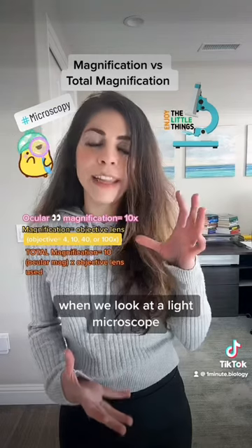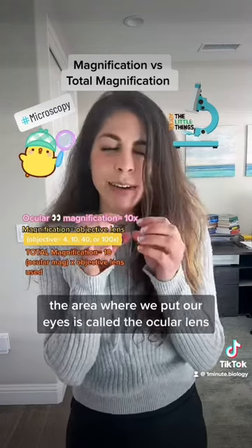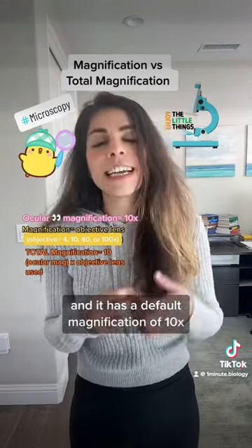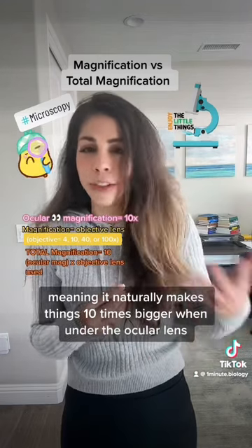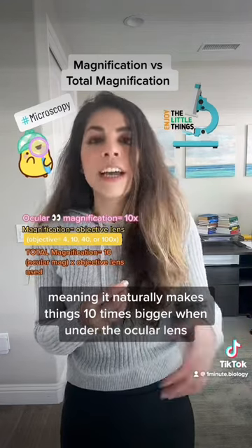When we look at a light microscope, the area where we put our eyes is called the ocular lens, and it has a default magnification of 10x, meaning it naturally makes things 10 times bigger.